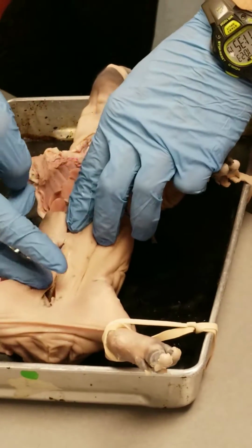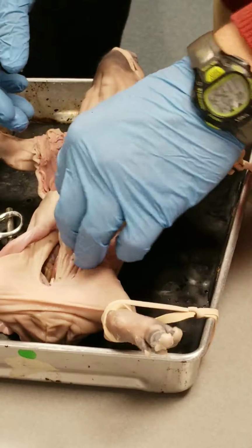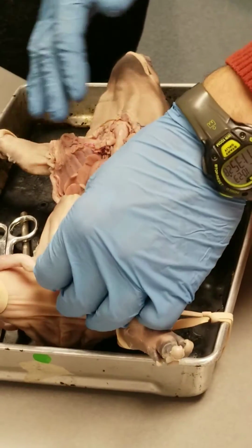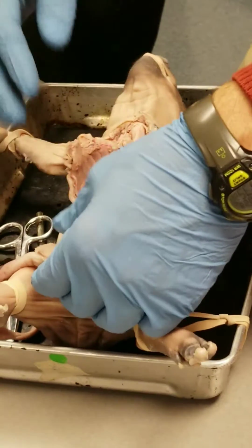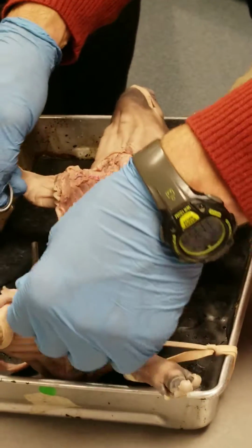If you just cut across the bottom here and remove that, you know, Lorena Bobbitt's gone, all right, not going to see it. For those of you that don't know that reference, doesn't matter. Cut the penis off, and it's lost. Go throw it in a field.